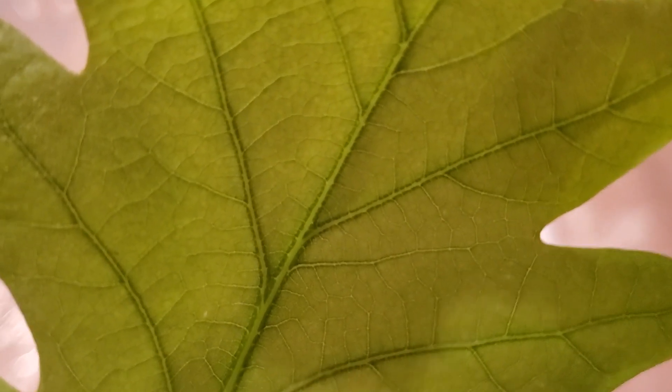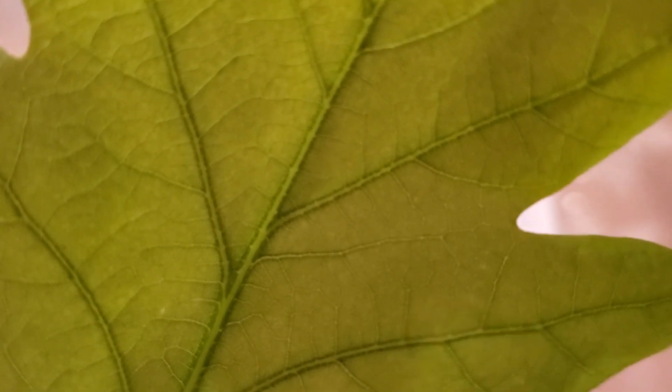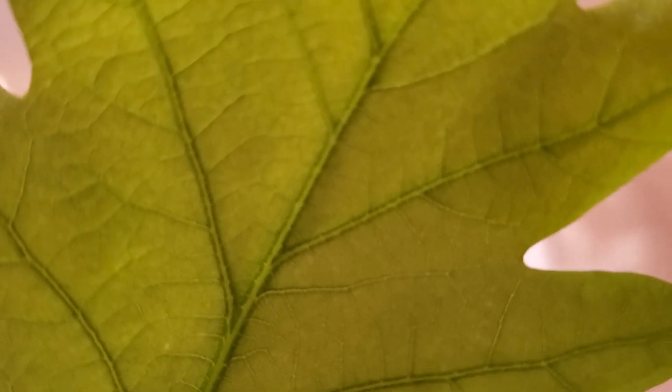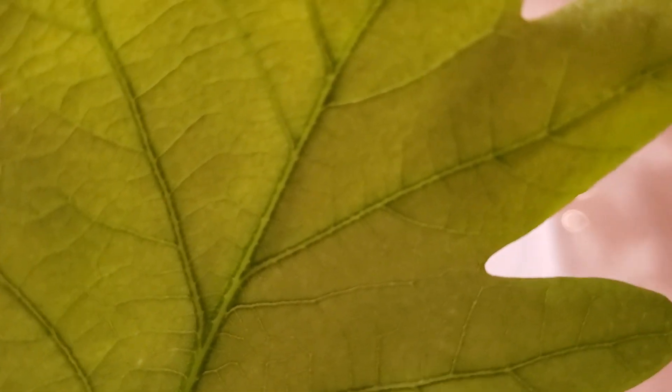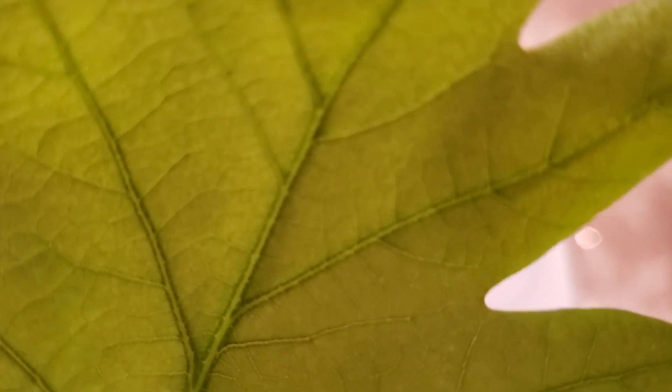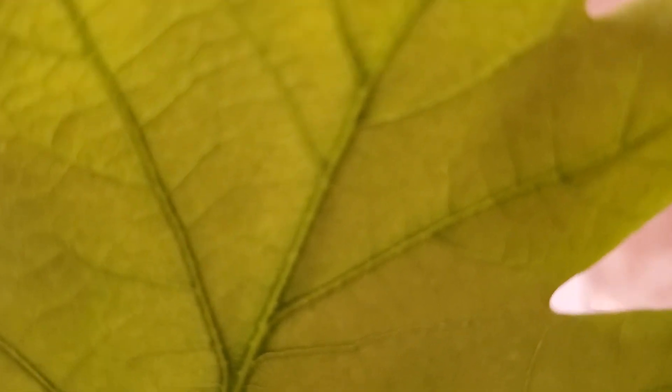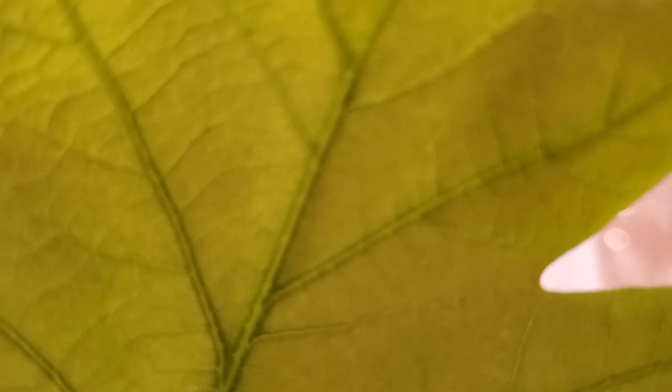So I'll tell you what. I'm going to zoom in right now and give you a different way or a different chance for you to observe. It's another fancy science word. Observe this leaf and make a prediction. What are we going to see under this microscope? So this is as close as my phone can get without it getting too blurry. So what do you think it's going to look like under that microscope?